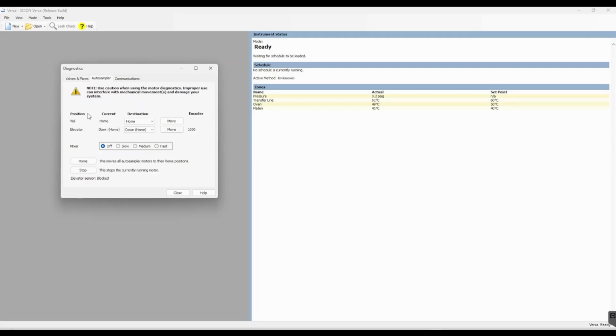I will just speak through what each of these headings are. The position, this field lists the component that can be manipulated, so here we have the vial and the elevator. The current, this field lists the current position for the corresponding component. And then we have move, this causes the corresponding component to move to the position designated in the destination field. So here we have the option of home and then the vial positions.